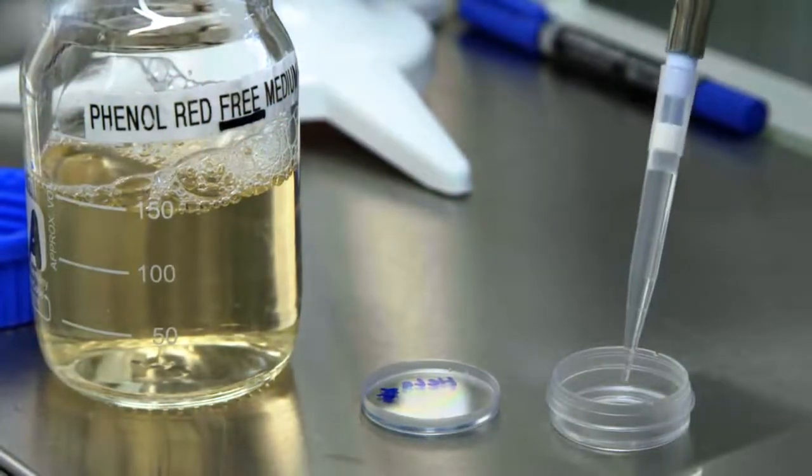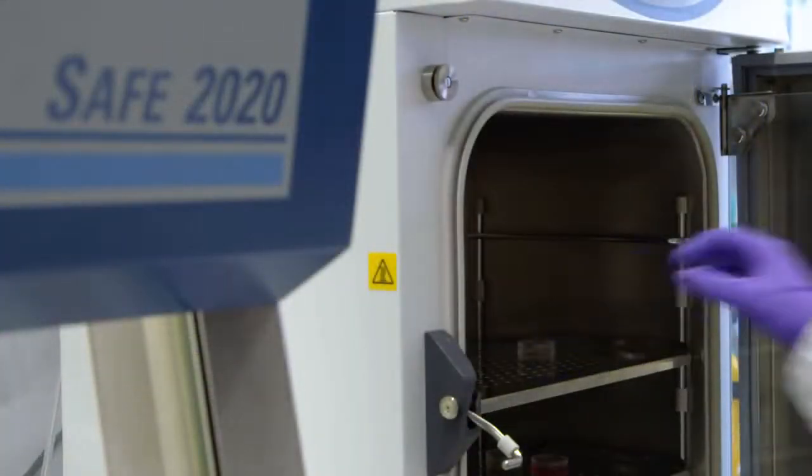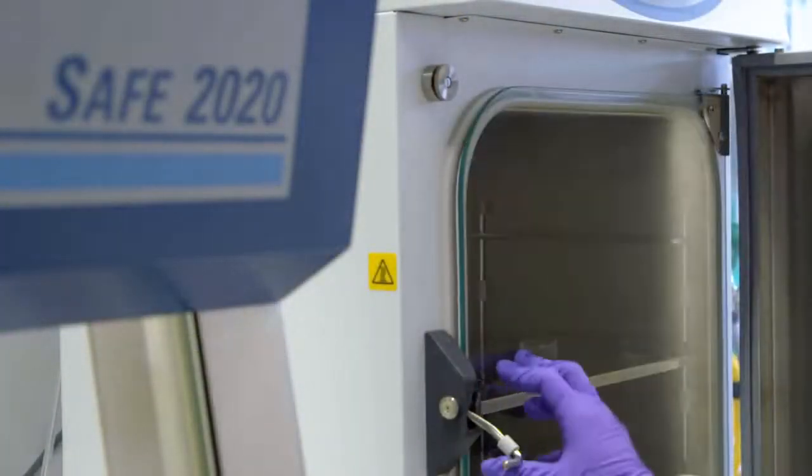Then feed the cells with fresh phenol red-free cell culture medium and return the culture to the cell culture incubator protected from light until live imaging.